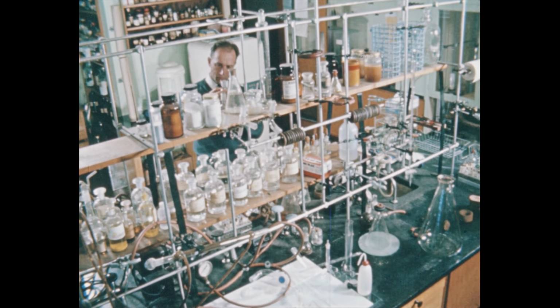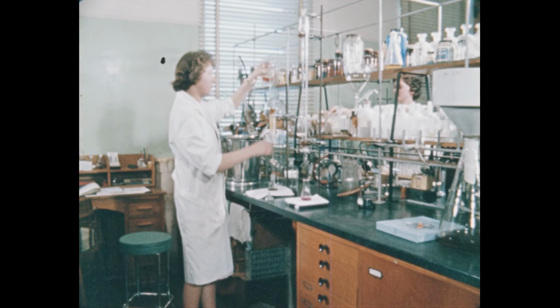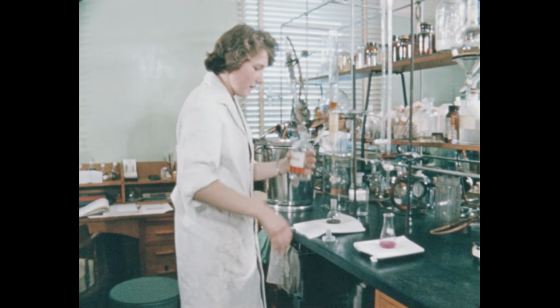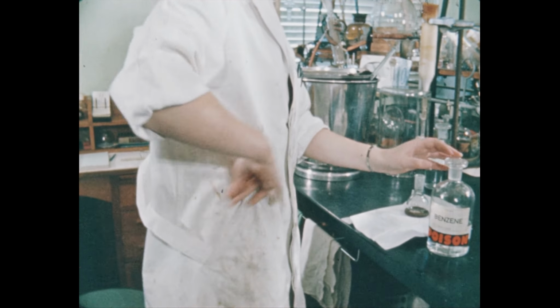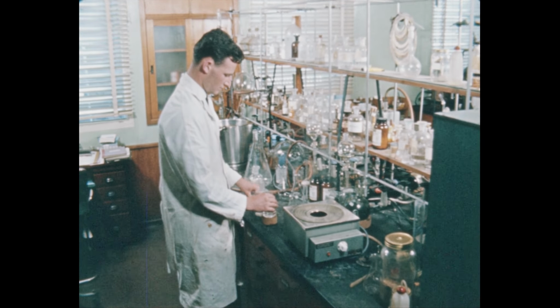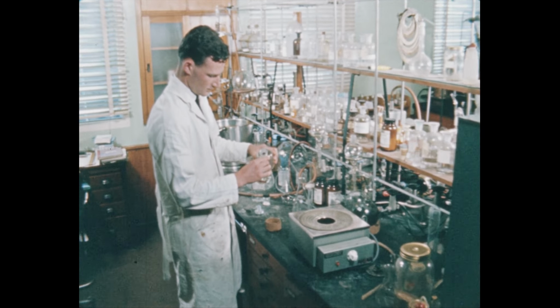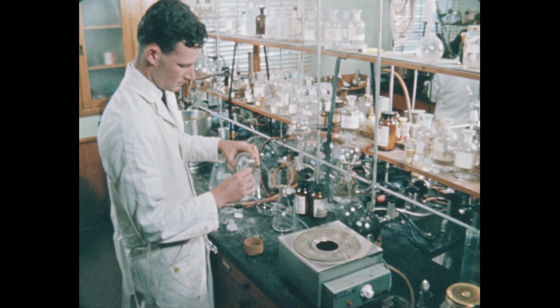In too many chemical laboratories, safety practices have been forgotten or are ignored. Examples aren't hard to find. Here, the solvent evaporating into the air could affect anyone in the laboratory. This work should be carried out in the fume cupboard, and solvent wet hands should be washed. Here too, the escaping vapors, however small the amounts may be, add to benzene's cumulative poisoning effects.